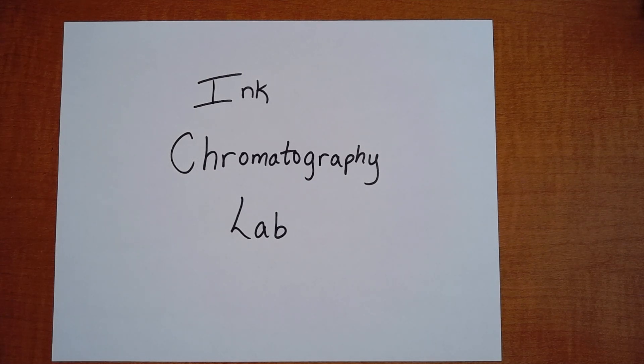All right my darlings, we are going to be doing an ink chromatography lab so I'm going to show you what we will need for this experiment.